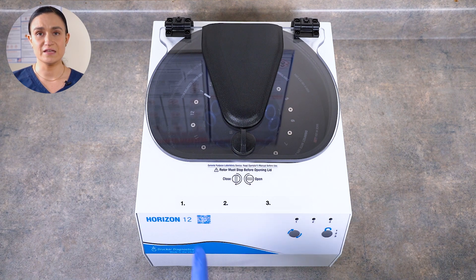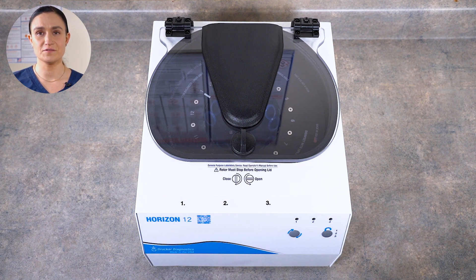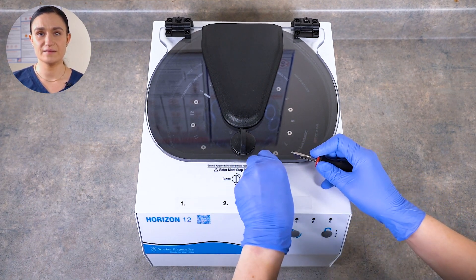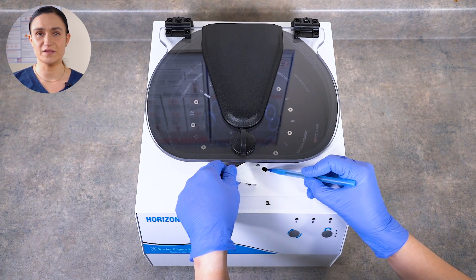The Emergency Unlock is located underneath the open-close sticker and just in front of the rotor chamber. Use the screwdriver to peel up the sticker. The Emergency Unlock is accessible through this small hole in the cabinet.